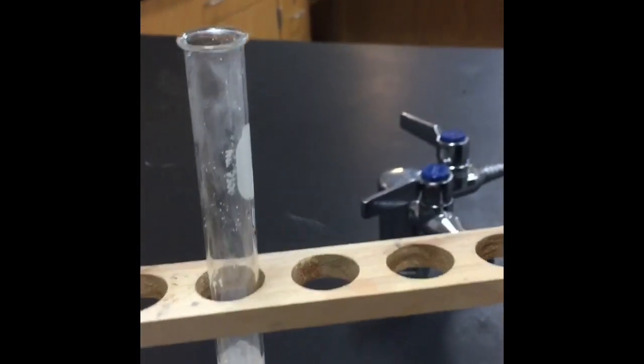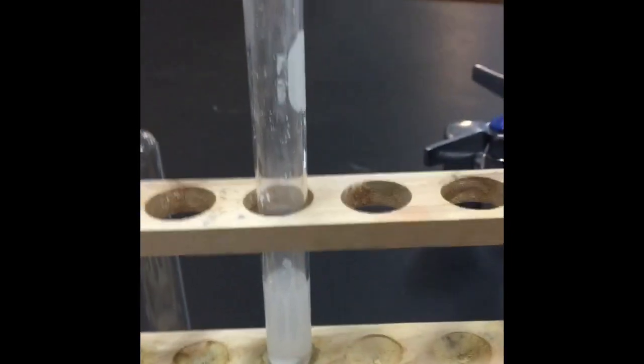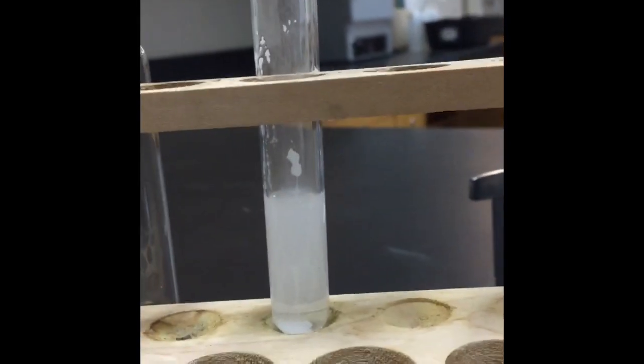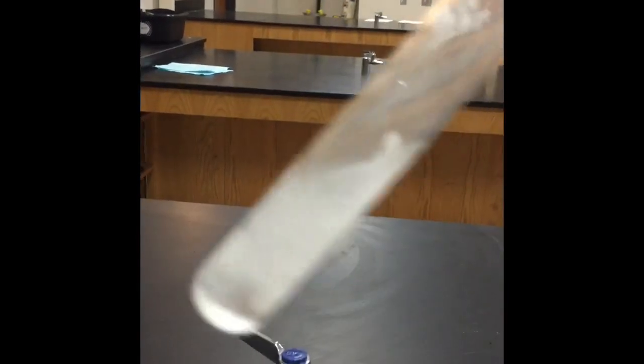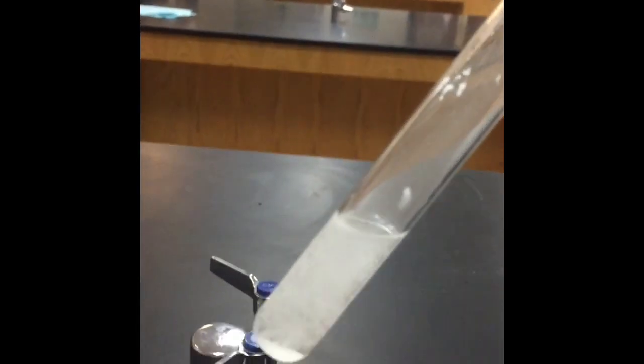It's a carbonate, and again, from a carbonate, you always get carbon dioxide gas and water. So if you can see all the liquid that's in there, that's the water that formed during the reaction. There is also a white solid. So you need to think about what that could be, what compound that could be. There's a third compound besides water and carbon dioxide. There's going to be a third compound that forms as a product in this reaction.